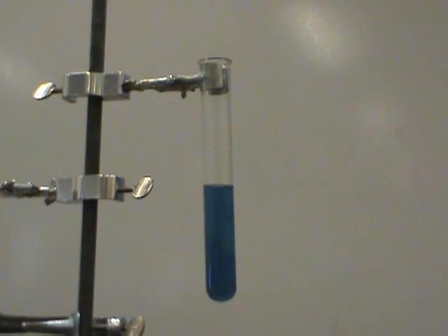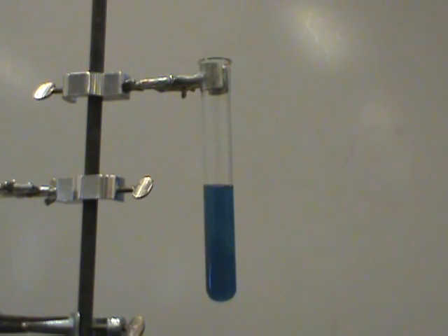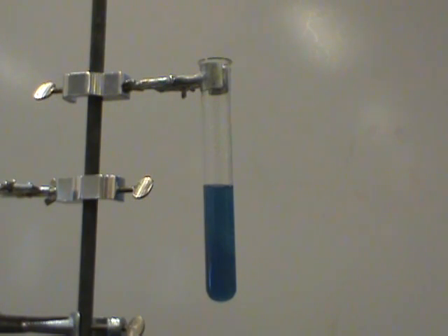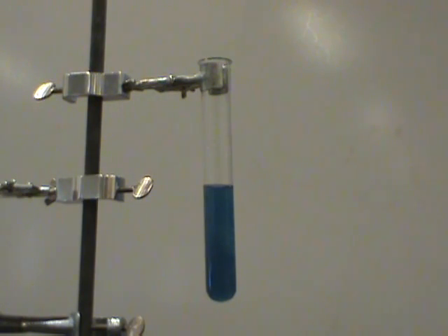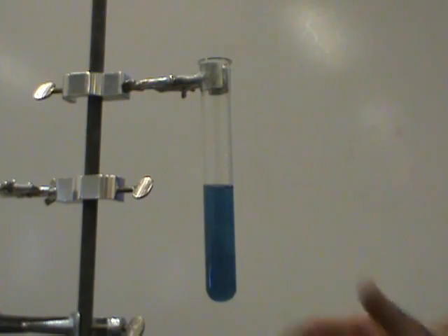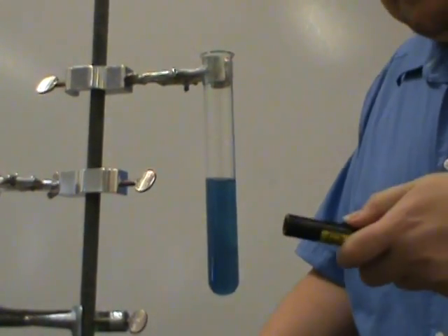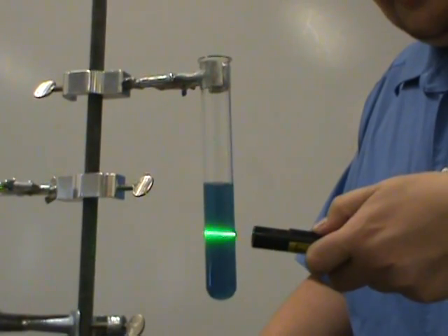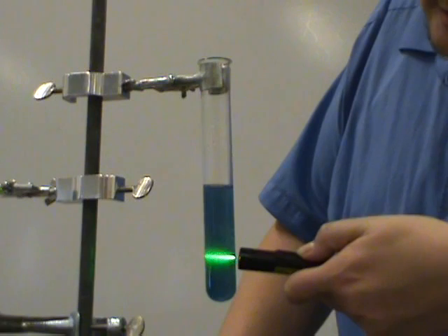Water broke the ionic bonds to allow the ions to flow freely throughout the mixture. And the second the cobalt and the carbonate came into contact with each other, they, being insoluble, formed a blue crystal — trillions upon trillions of blue crystals — which made the solution cloudy. Watch what happens when I pass a laser through it: you can actually see the path of the laser beam because of the crystals.